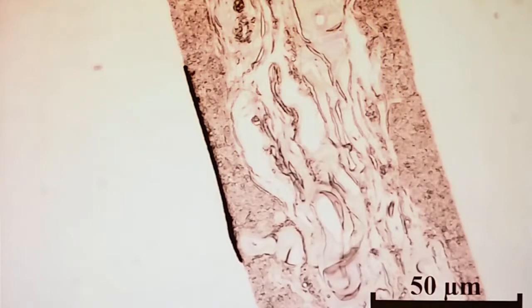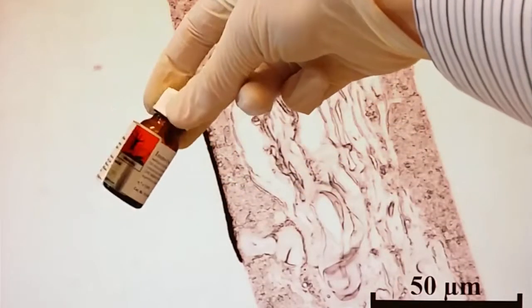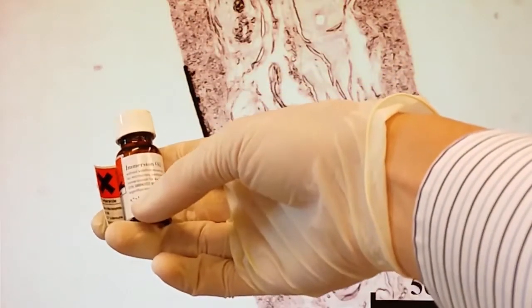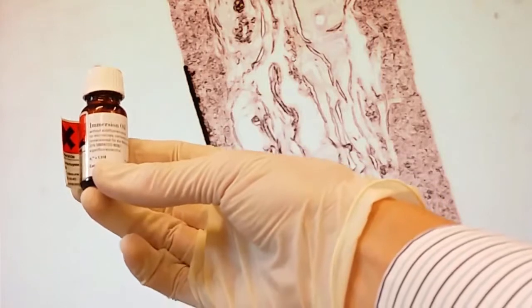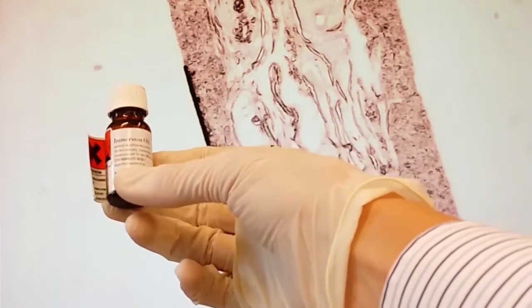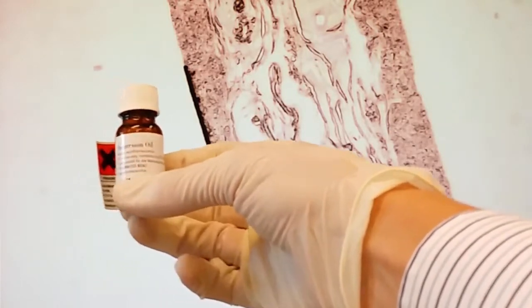Let's put on some immersion oil and choose the 1000 magnification and see what the limits of this system are. So here you see the immersion oil. There are different refractive indexes on them, it's written on here, and you need to match that with the objective that you use. This one is 1.518. So you put a drop on top of the cover glass. The idea is that the drop shall fill the empty space between the objective and the glass. And that will collect more light into the objective.